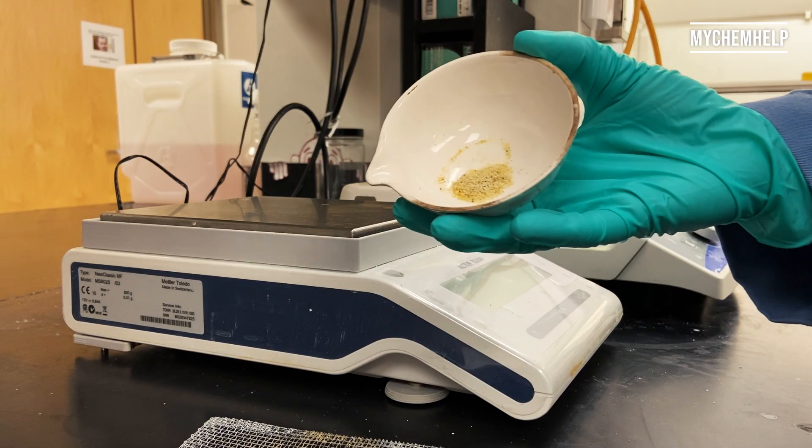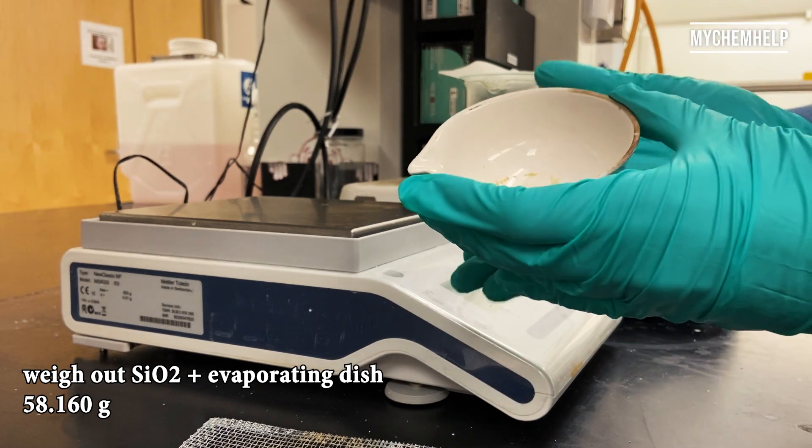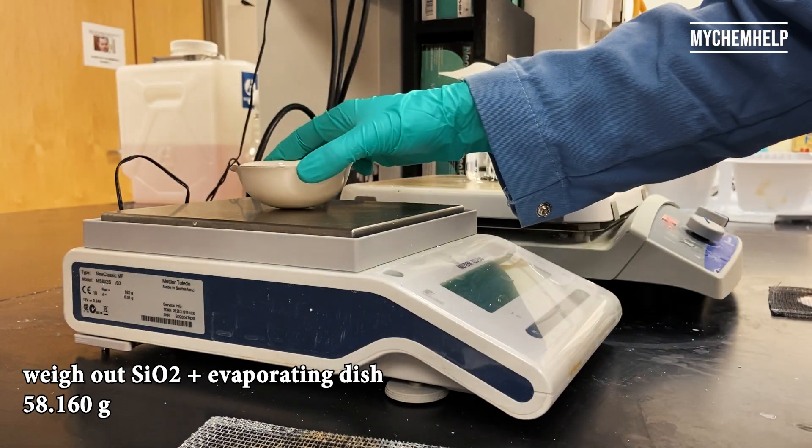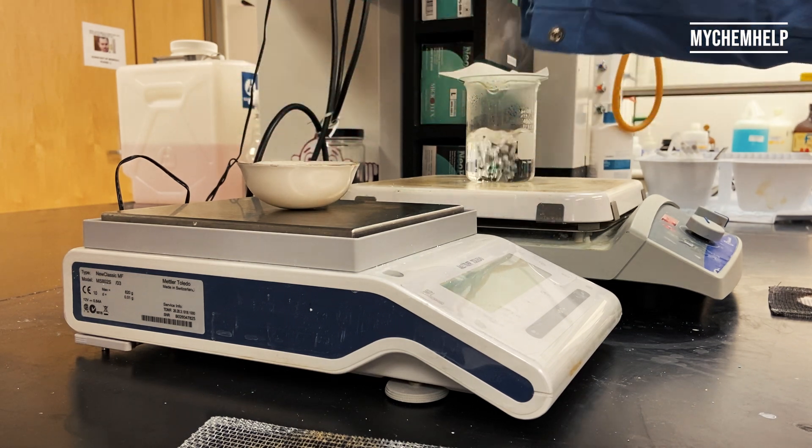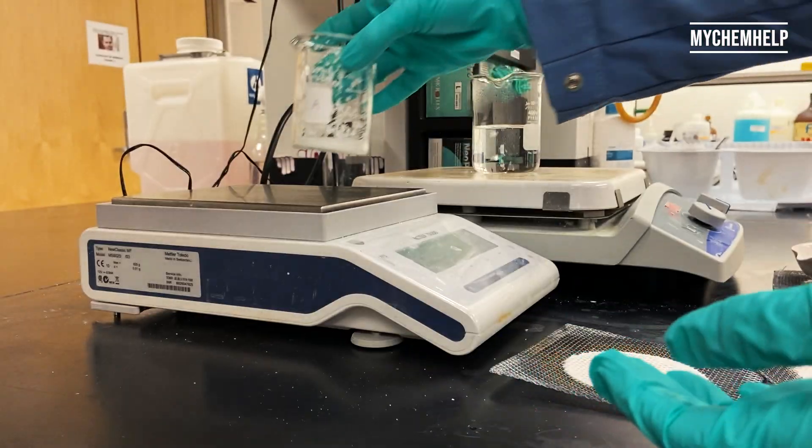So there's our dried sand, and I'm going to weigh that out. And our sodium chloride sample.